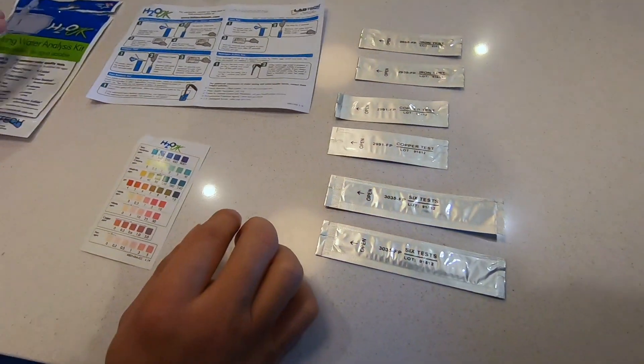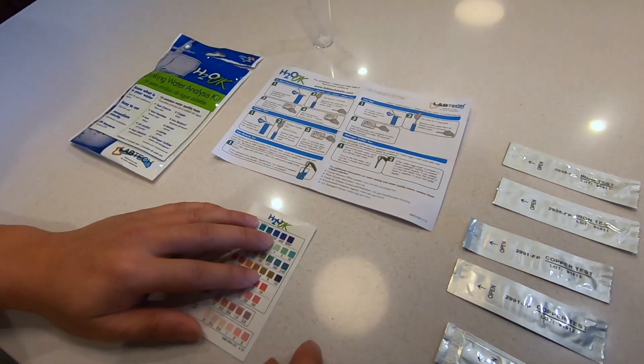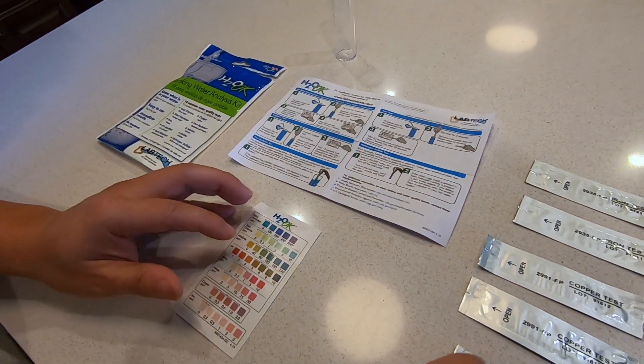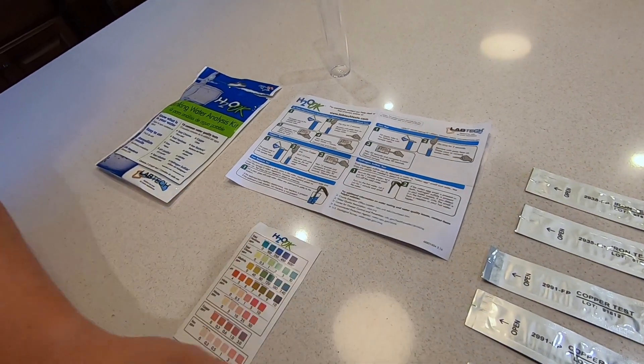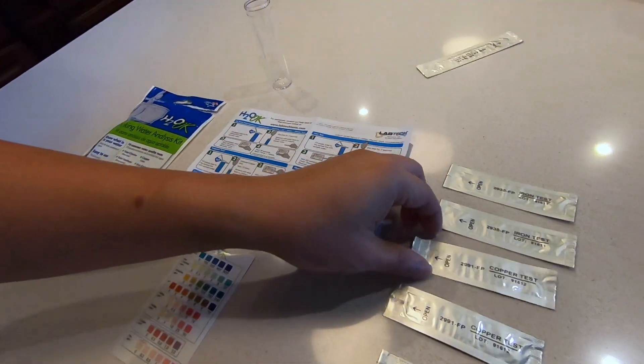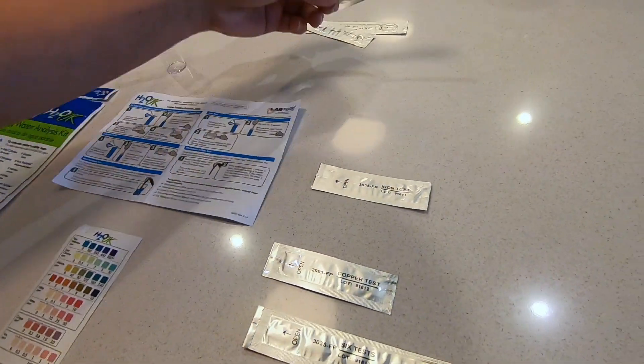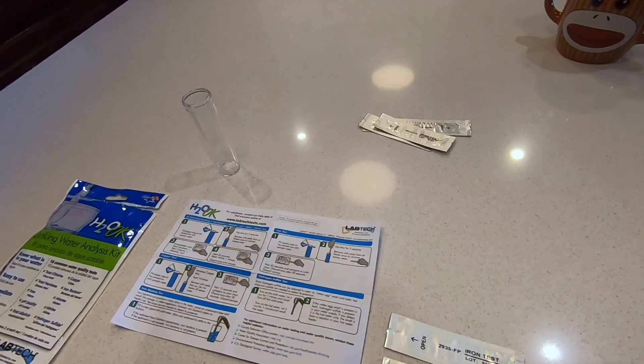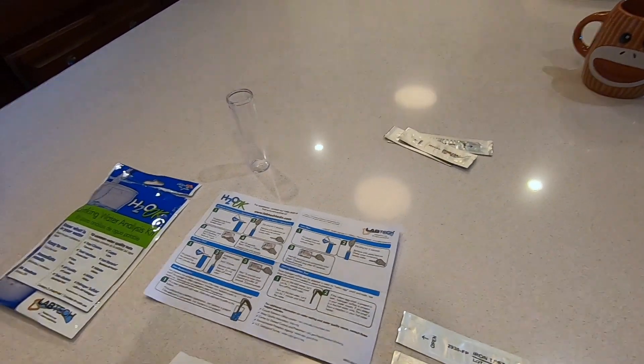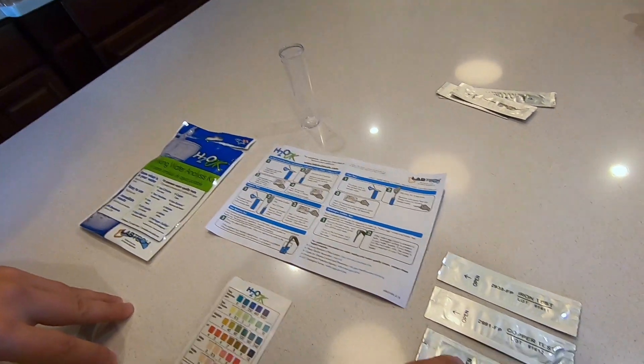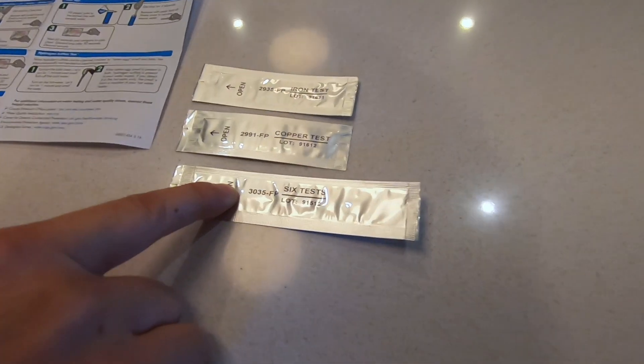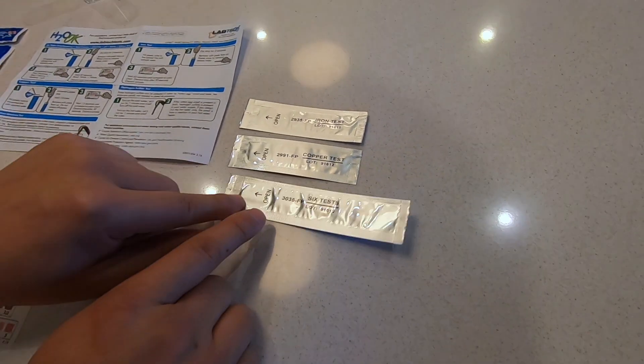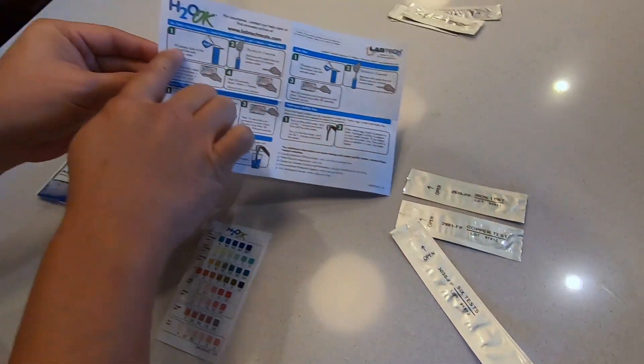I am going to perform each one of these tests one by one, so I'm going to remove the test strips that I'm not going to use.